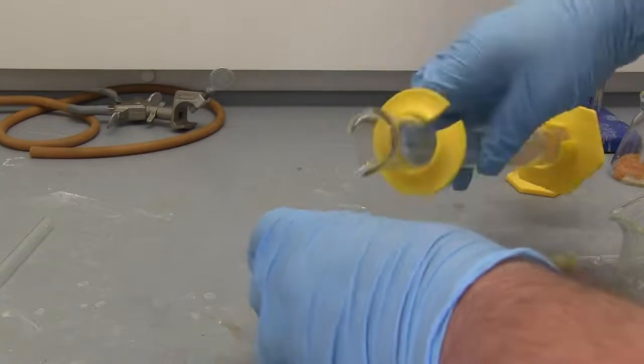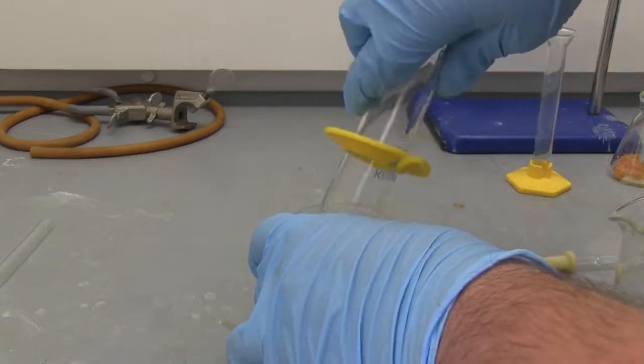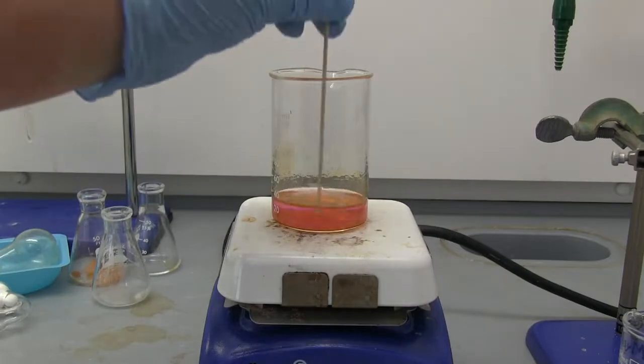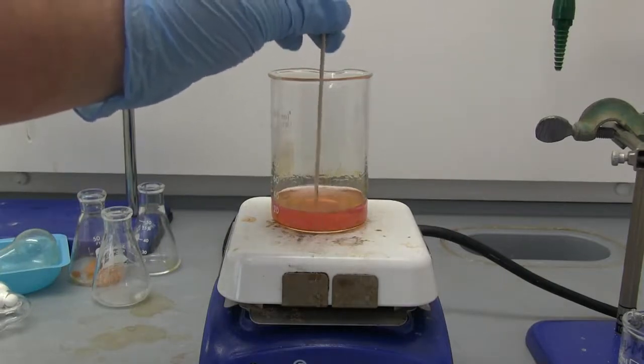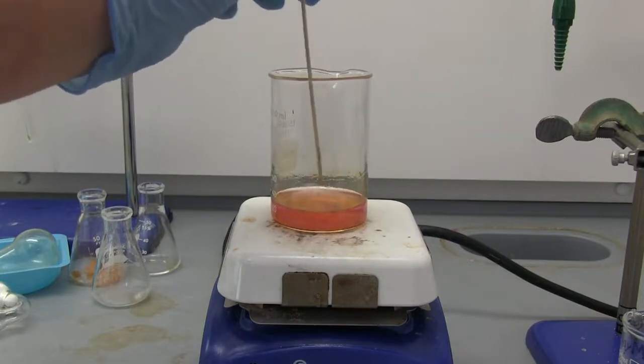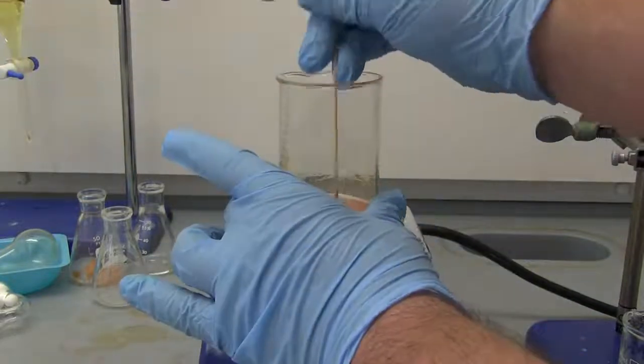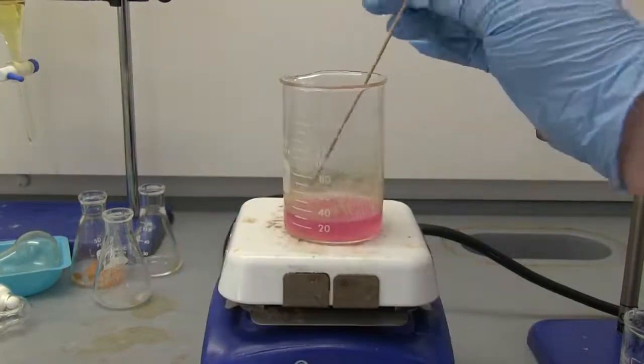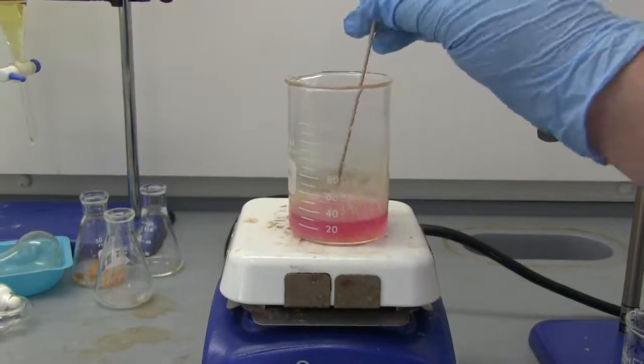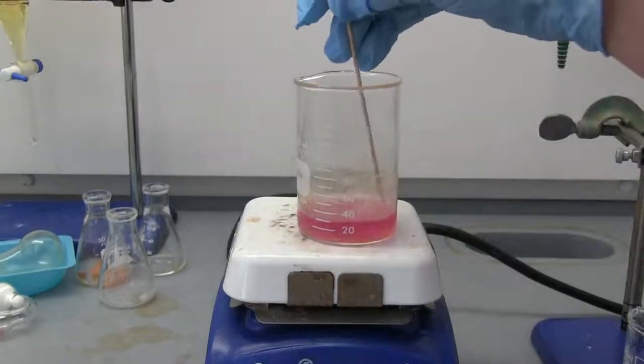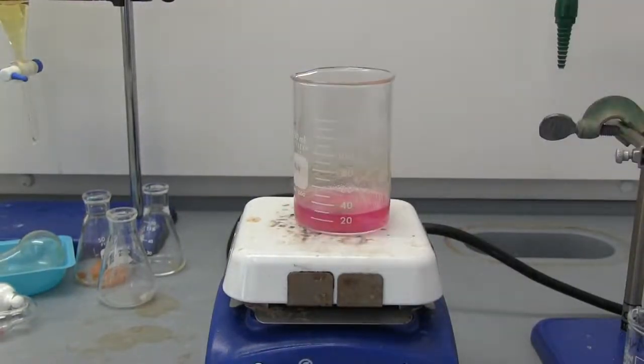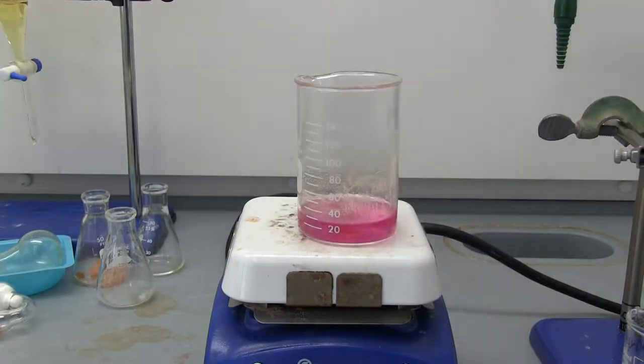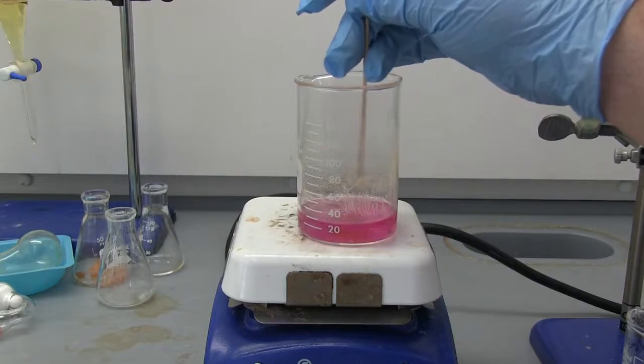All right, so I have a little over 20 mL of hexanes. We're going to add this to our beaker and next we will heat it up. So we're going to heat our solution here, only turn it to about two, and we're going to use this stick to try and break up any of the solids that are in there. So we are starting to get some boiling. We do have a bit of solid here in the middle that I'm trying to get dissolved.